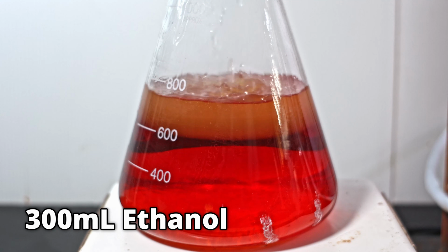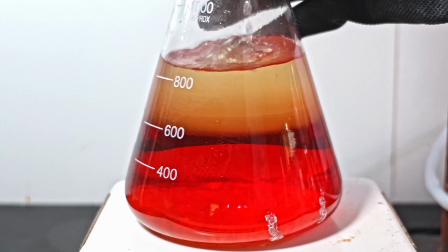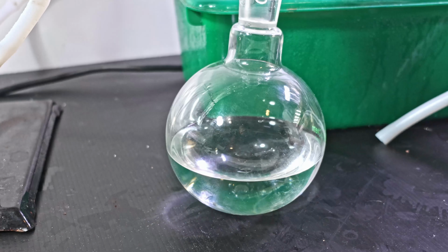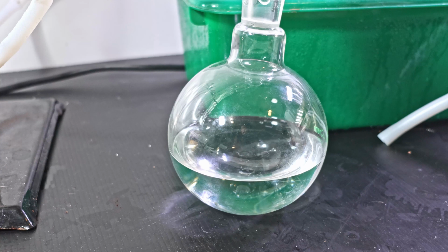This makes a strange color gradient. If you know why this is, feel free to comment. Later, it all becomes red again. I boil it naturally to drive off the methanol. As you can see, I've collected quite a bit of what I'm hoping is nearly pure methanol.